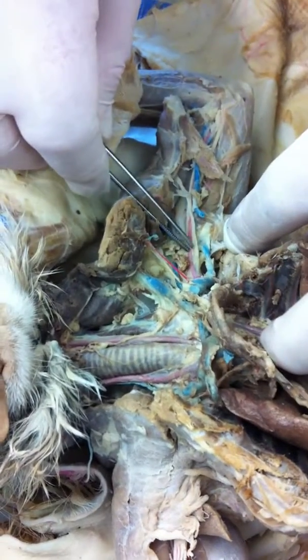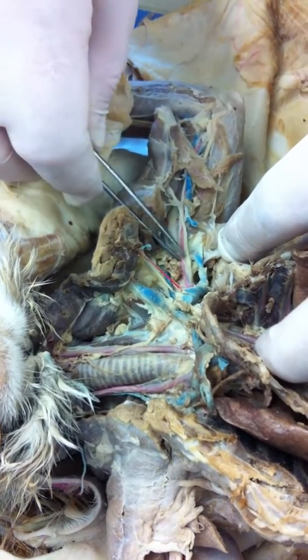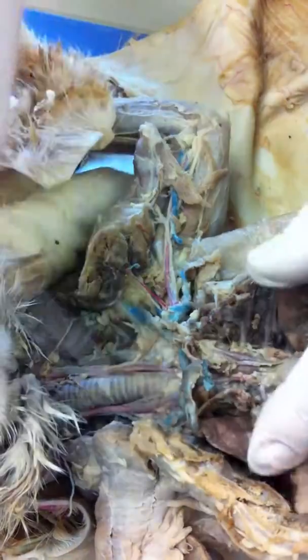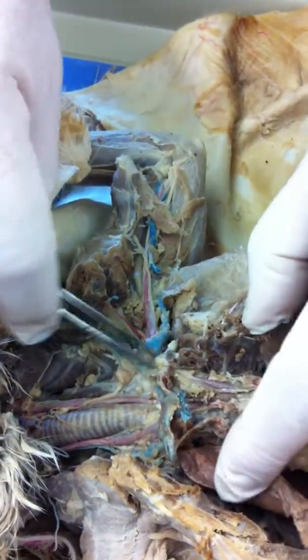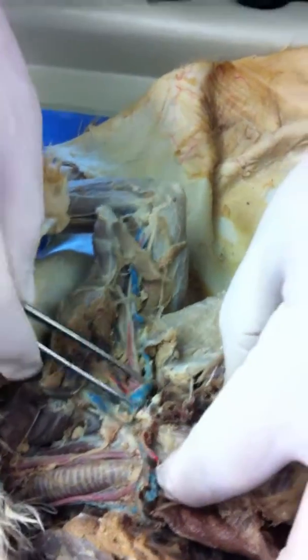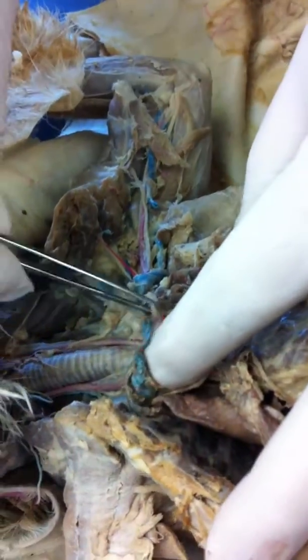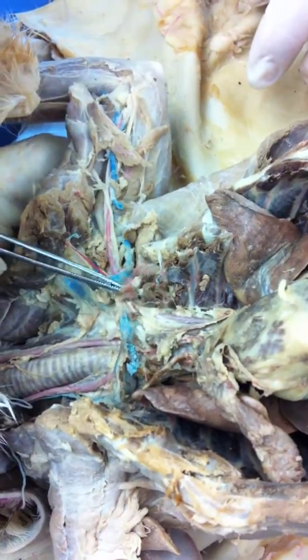So, what did you think this vessel is? And then that has to be brachial. Right. Where'd it go? Well, it's laying right next to the torn up brachial, that's Classmate blue. I'm not going to invest a lot of time in it. I think this is long thoracic going down the chest wall. That's a branch off of it. Okay. See long thoracic right there?